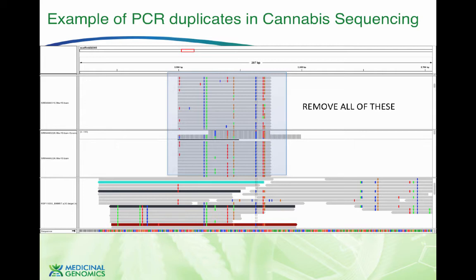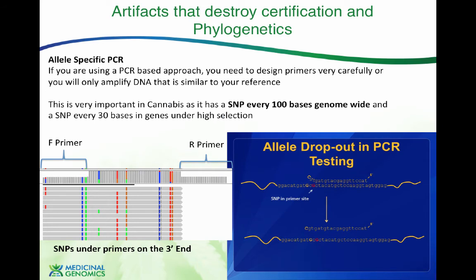And if anyone goes to recheck this, even after they've been given a certification, they're going to find that the sample was genotyped wrong, and they don't actually know what they have. And so their certification is bogus. So this is critical to really dig into. So let's expand on this a little bit. So what is going on when you have this much primer territory in what you are trying to sequence? And what I mean by this much primer territory, this is 25 bases here, this is 25 bases here, and there's 50 in between. So already you've got half of your DNA sequence is synthetic, human designed, and that means it could fall on top of an unknown variant that's in the genome and selectively amplify only one allele.